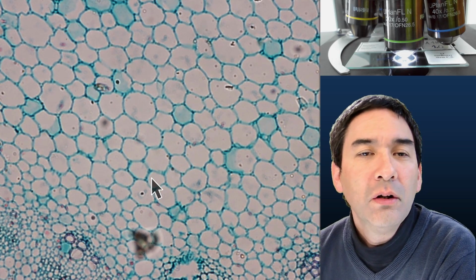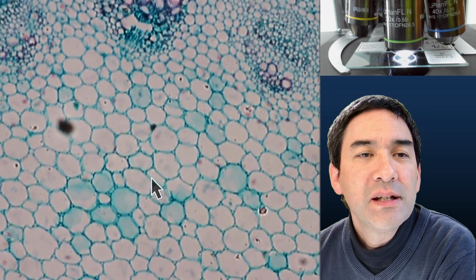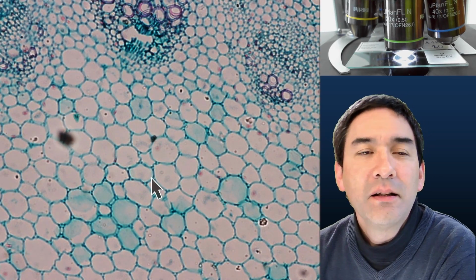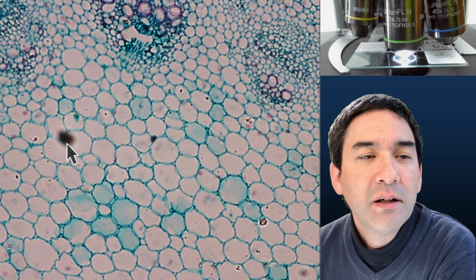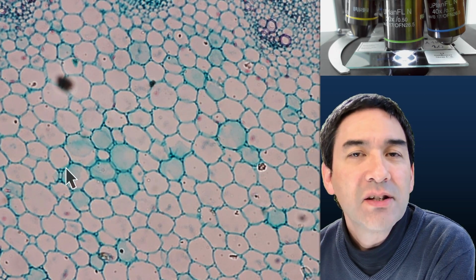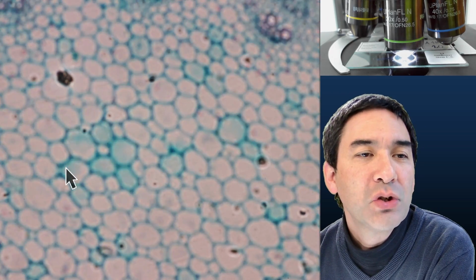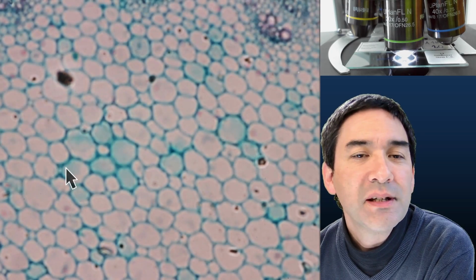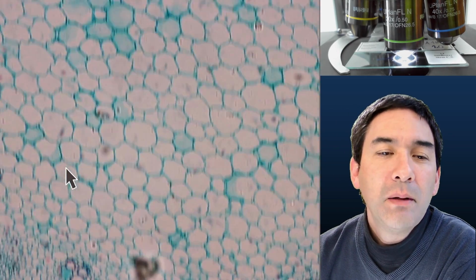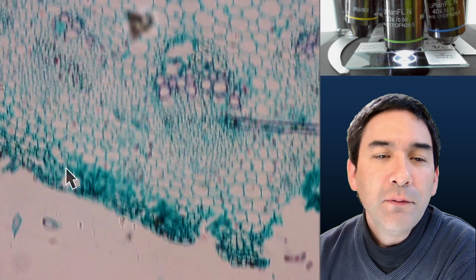But overall, the slide also is relatively complete, but you do see that it kind of lacks a little bit of volume. You see over here, a big speck of dust. I mean, I did wipe the slide, so it should not be on the surface, but it's quite well possible that this is somehow also part of the specimen. And this is essentially one of the differences here.